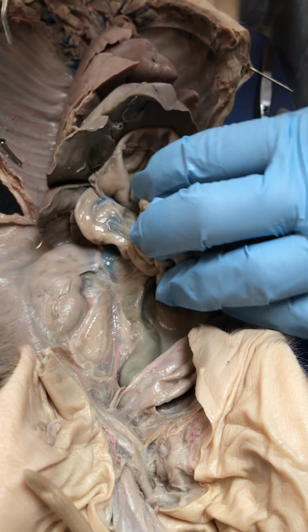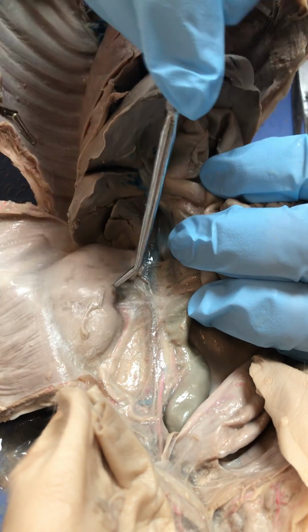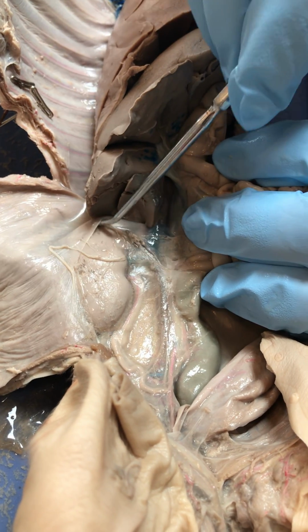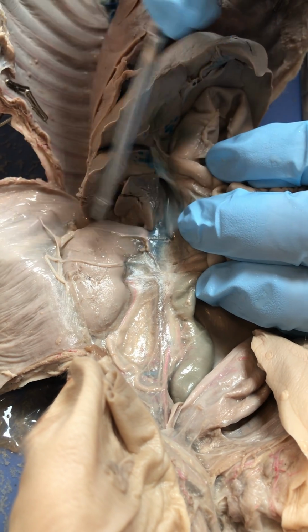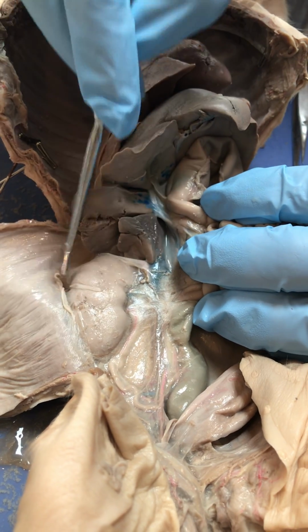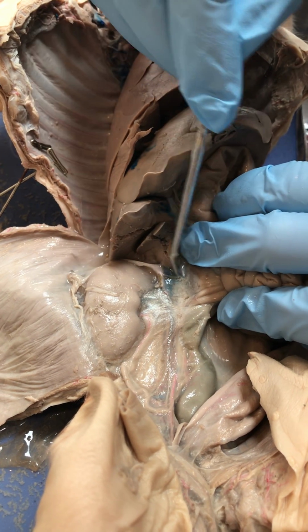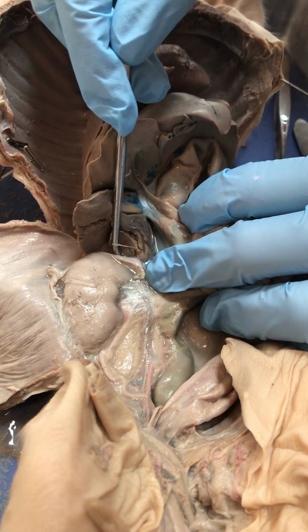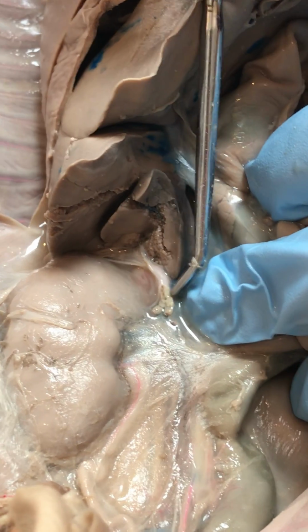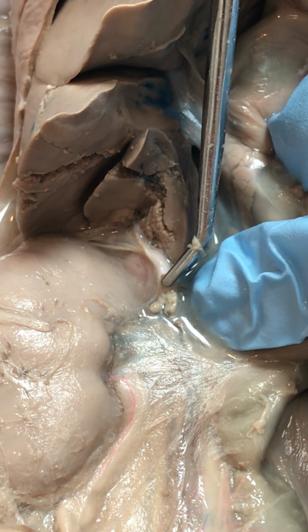Now, if we want to move retroperitoneally, let's look at the posterior aspect of the body wall. What we're seeing here is actually embedded in the body wall itself, beneath the peritoneum. Remember what that term is, retroperitoneal, is the actual kidney. So you can see the kidney here, very large, kind of bean shaped. Right in front of the kidney, if you look closely, you can see once again this rather diffuse glandular looking material right there. That's actually the adrenal gland, which is pretty neat.